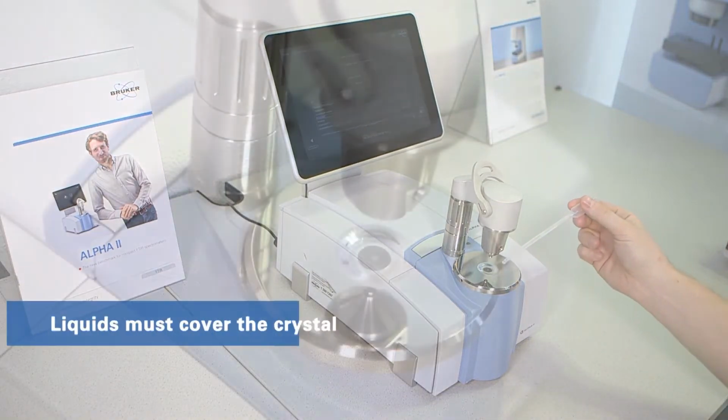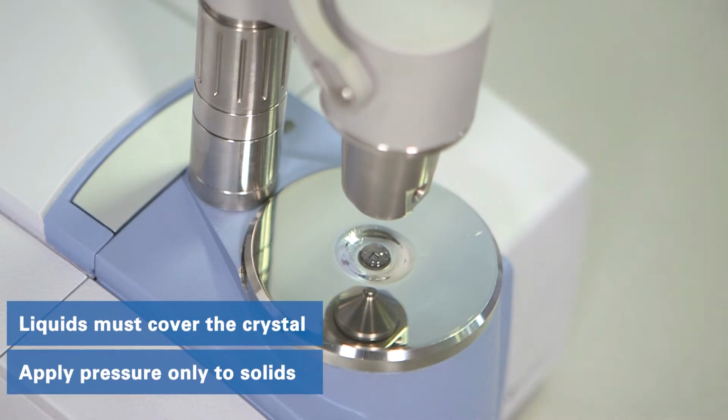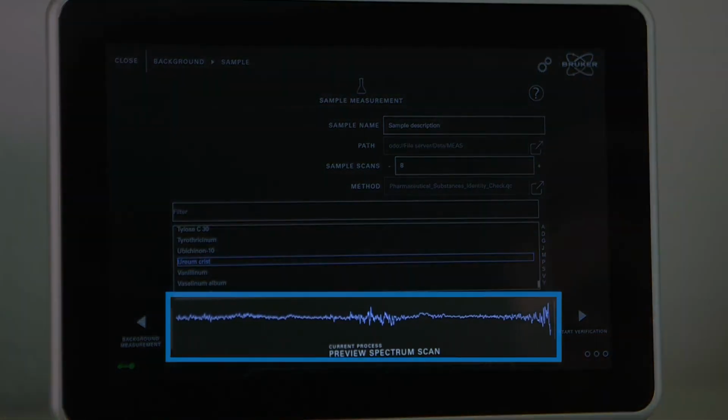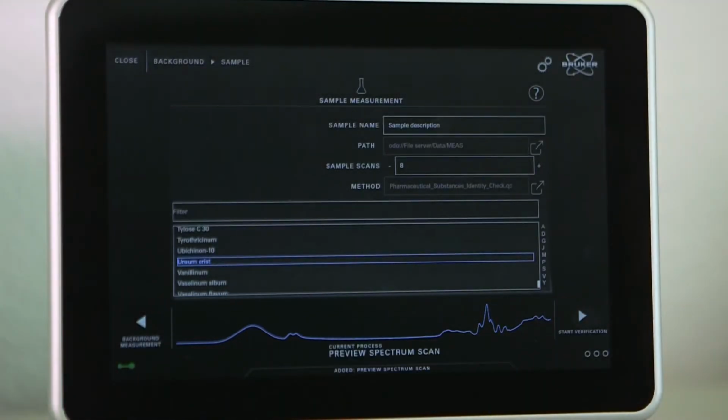When ATR is used, liquids and oils are directly applied to the crystal. Assure your sample covers the diamond entirely and apply the pressure stamp only for solids. The preview spectrum indicates the quality of contact between diamond and sample. It should already display the sample spectral fingerprint well above the baseline.